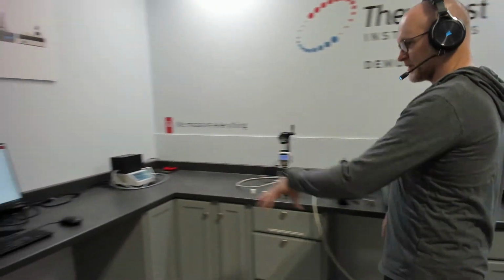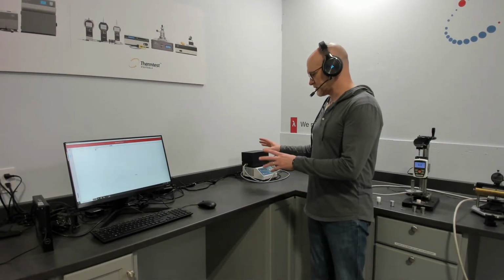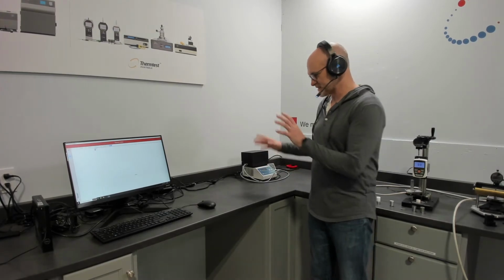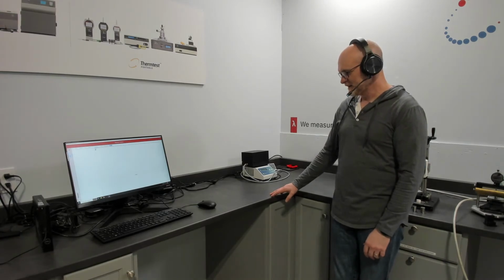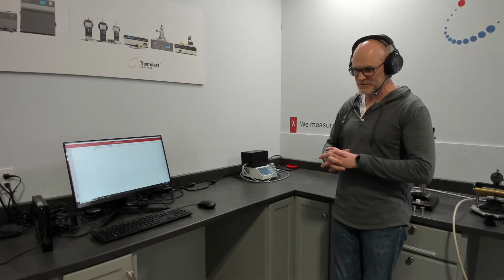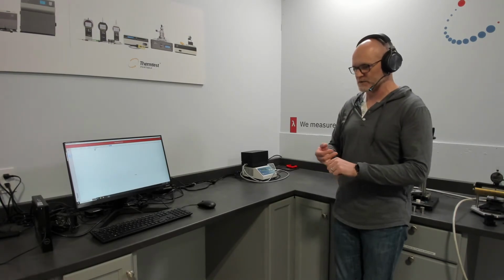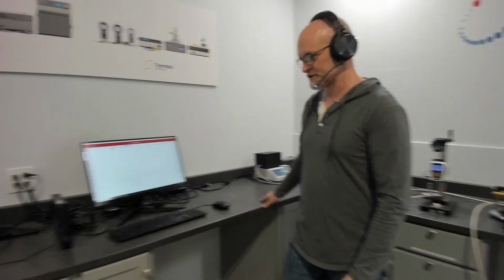Coming to the other side, typically we would have our MPV here, but it's on its way to a show. That will be back in the demonstration corner in the future, of course, but we use these instruments for various purposes. So typically there would be our MPV, which is our measurement platform, versatile. You'll have to visualize it here. It's our mid-range measurement platform combining multiple methods, transient plane source and transient hot wire for solids, pastes, and powders for thermal conductivity, thermal diffusivity, and specific heat. We certainly have a lot of demonstrations on that instrument.